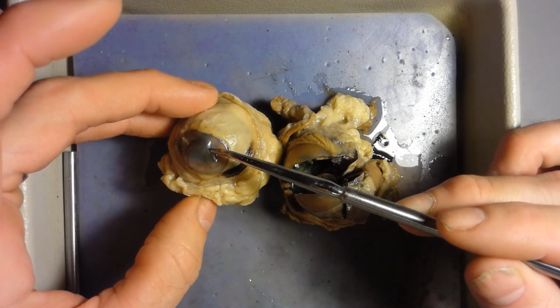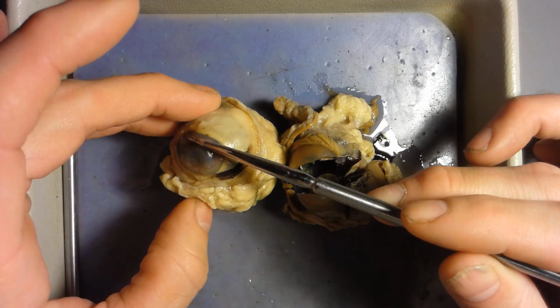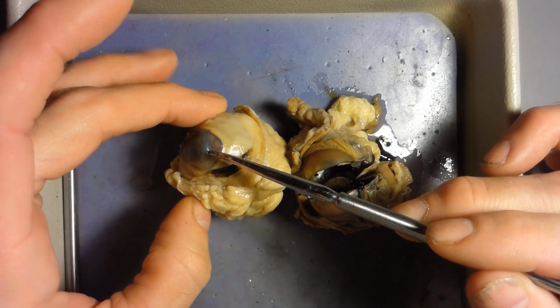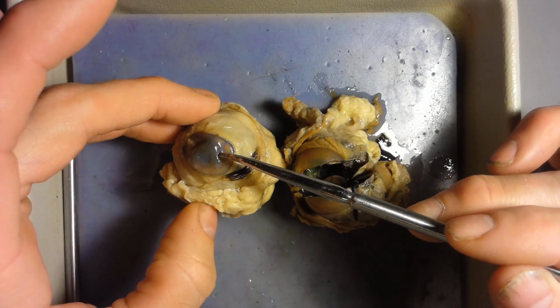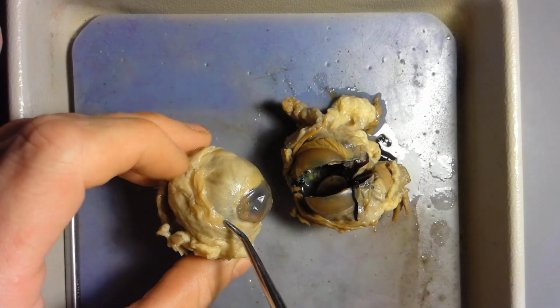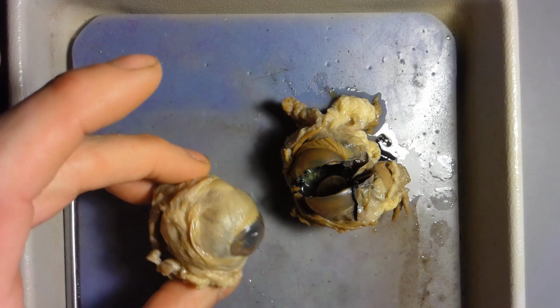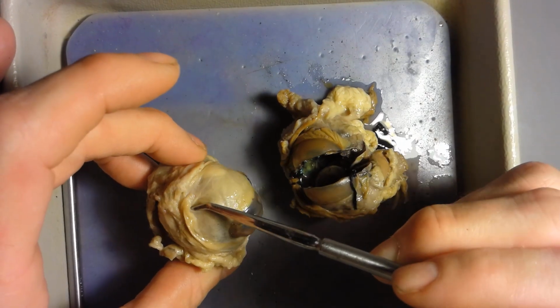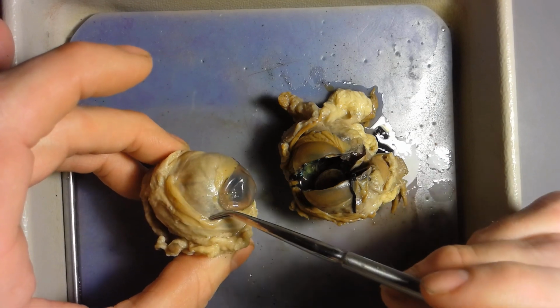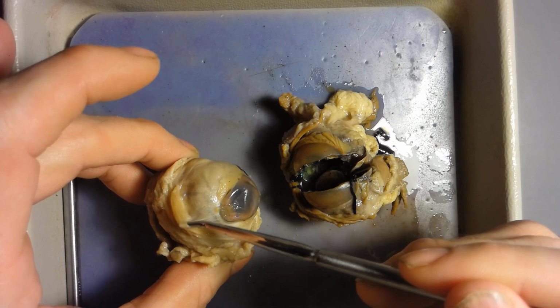Okay, first of all, the cornea will be right in front here. That clear curvature right there that covers up the pupil and the iris. So that would be the cornea. Now the conjunctiva, we did not see that in the eye model, but you can see it on here. It's kind of a folded up skin. It's a very thin skin that wraps around the whole eye. So it's very clear skin that covers up the whole eye here.